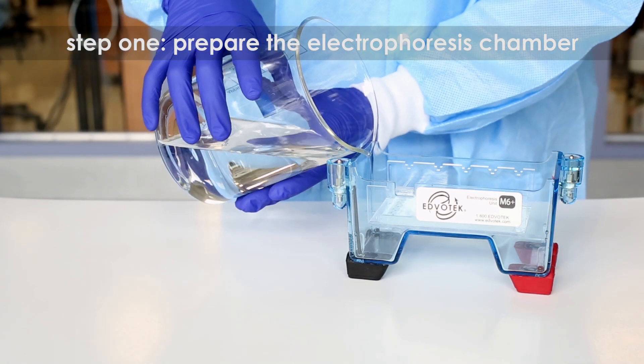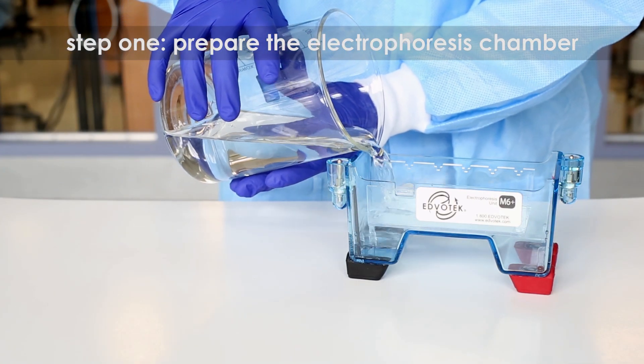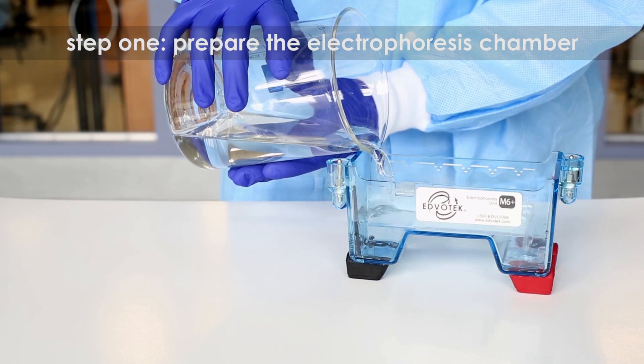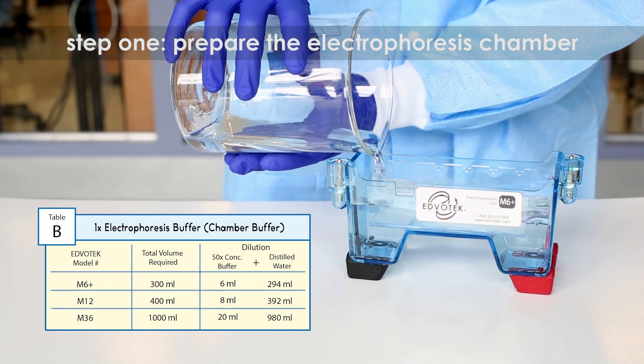Completely submerge the gel with diluted electrophoresis buffer. Refer to table B for recommended volumes.